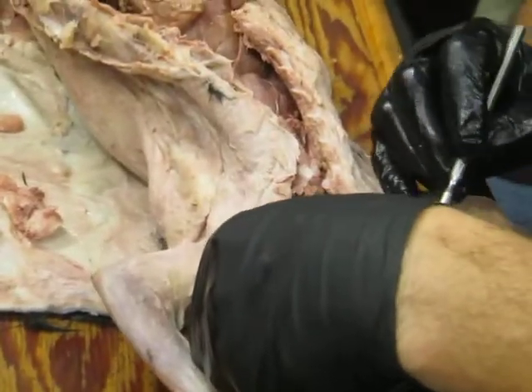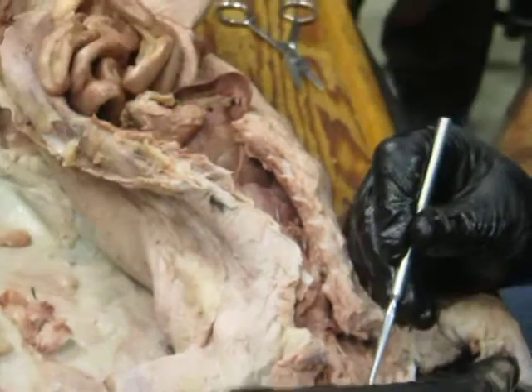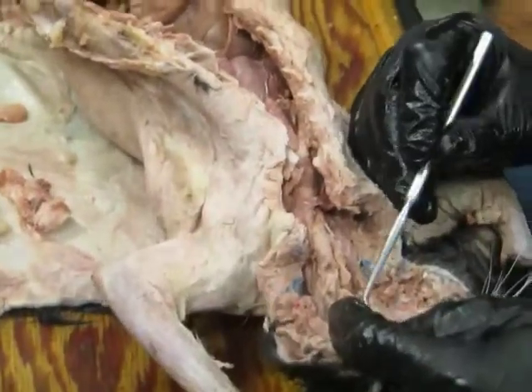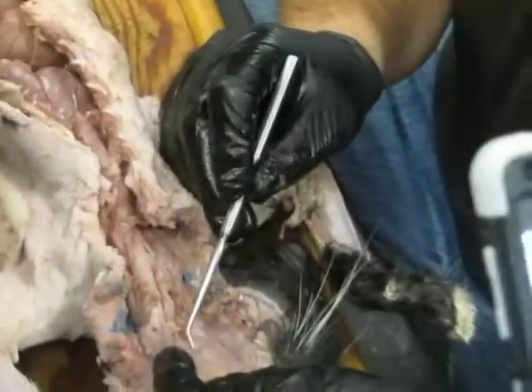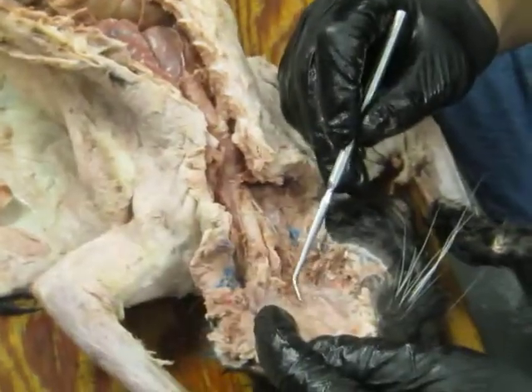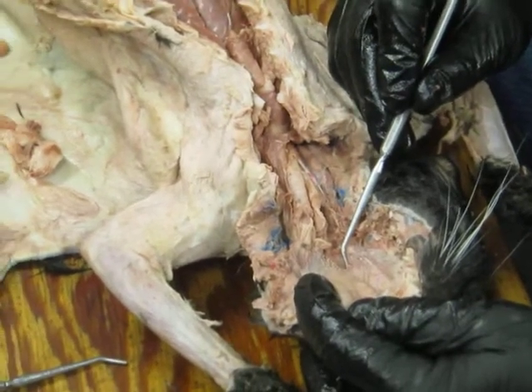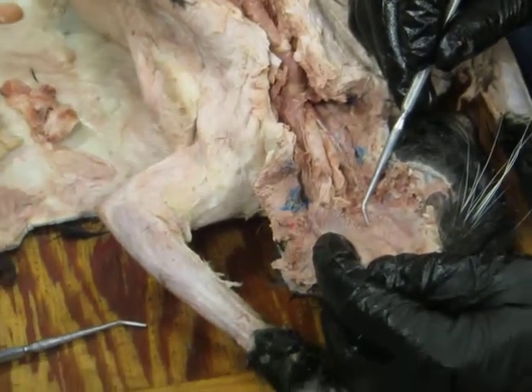And one cool thing you can see in here, if I can find it again, right here, in the region of the oropharynx, you see this little fold of tissue, the roof of the mouth, and this little papilla right there, and that's the tonsil, the palatine tonsil. Does it look like a tonsil?